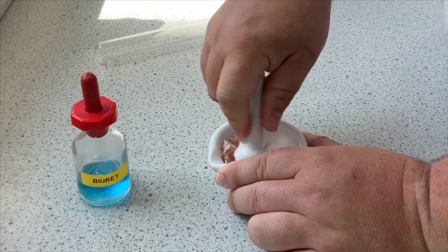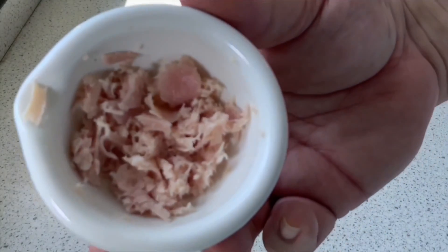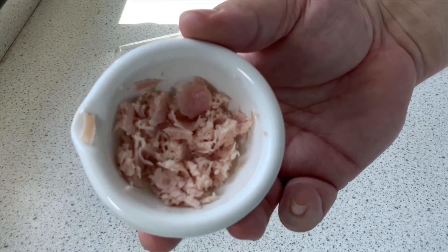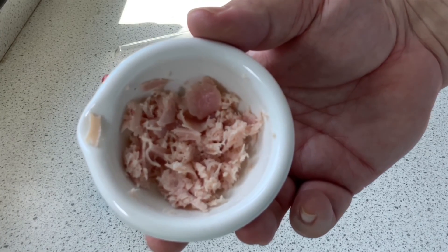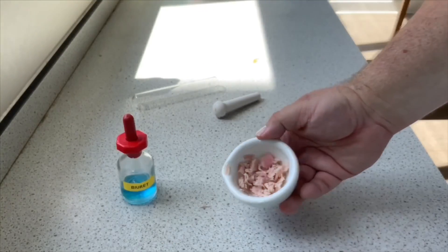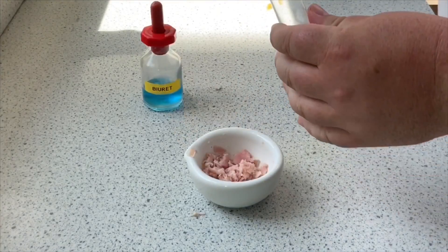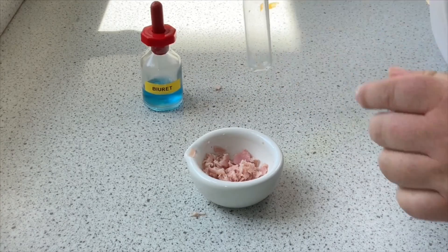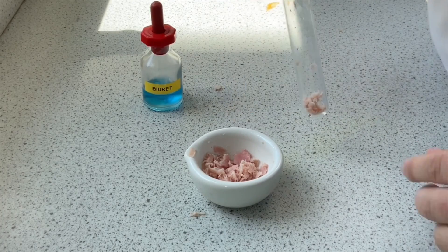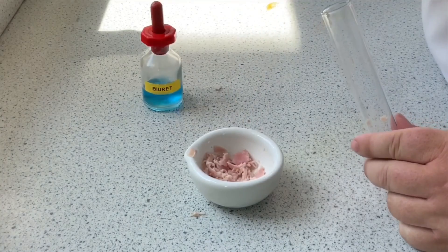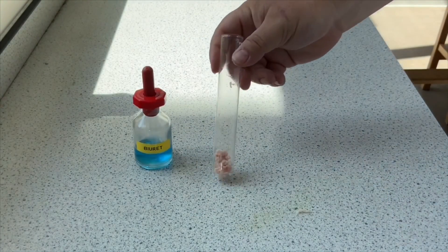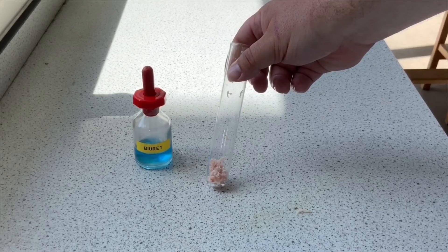So I'm crushing away here. I want to try - oh look at that, should use some tweezers there, some forceps. Using the fingers isn't very good, but there you go, we've got some inside the boiling tube.